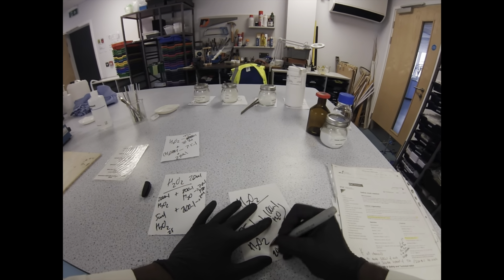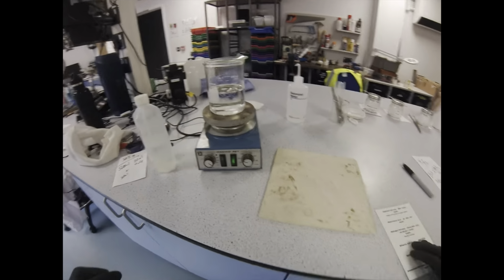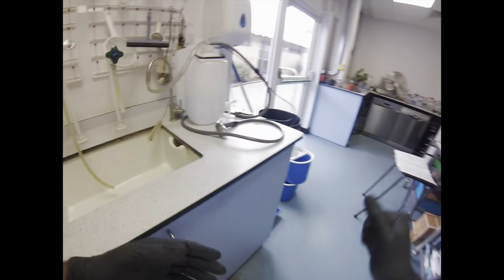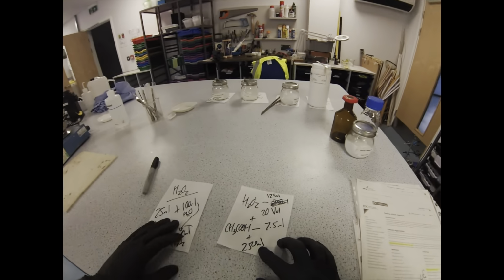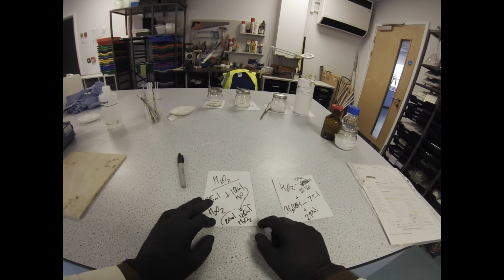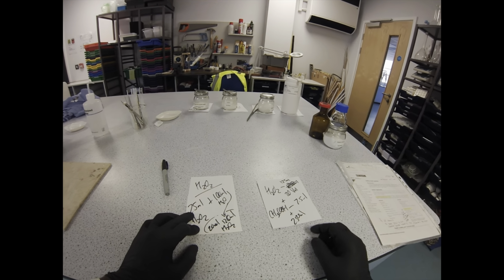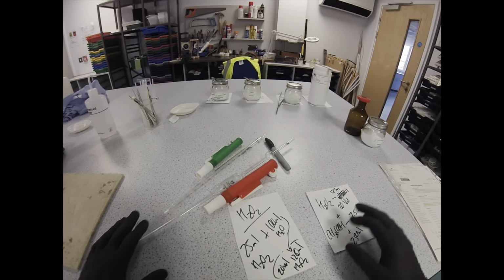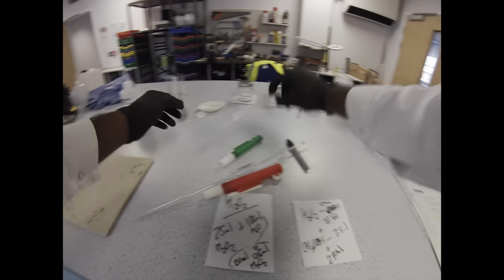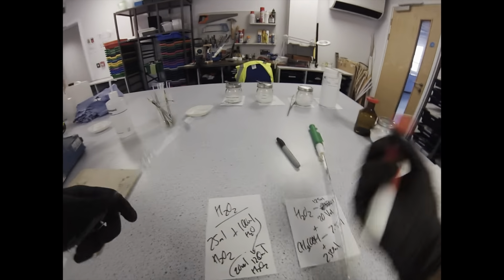Now, classically, I forgot to hit record when I was doing my acetic acid calculations. You can kind of see them here on the right-hand side. Basically, the original recipe called for 30 ml of acetic acid. So all you do is halve that and halve that again. So that's 15, then that's 7.5. So we just need a small pipette to be able to pipette out 7.5 ml of concentrated acetic acid. Then you bring that final solution up to 250 ml with water.